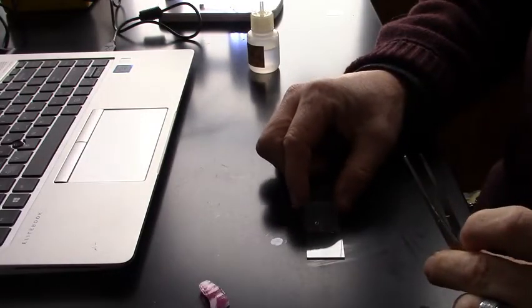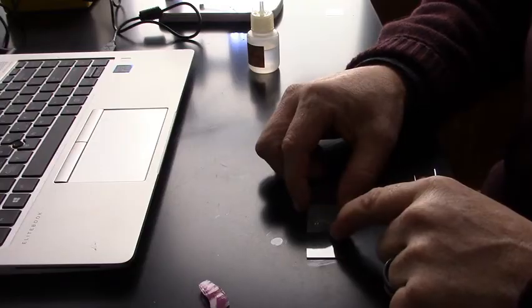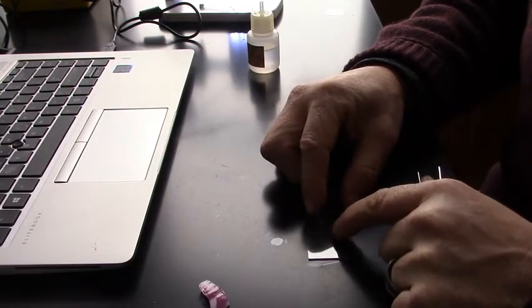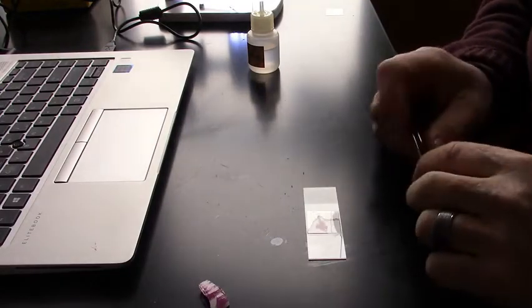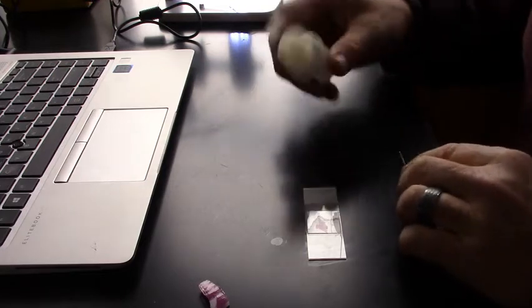So it's about 96, 97, 98% water. Put a little cover slip on. That's going to hold everything in place and actually allow me to do this technique.